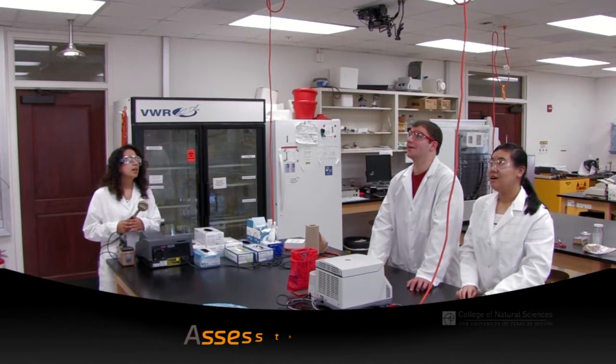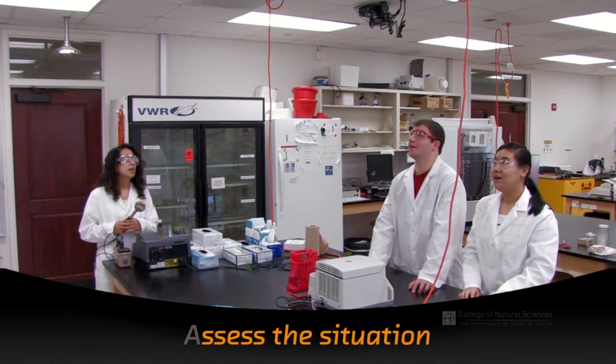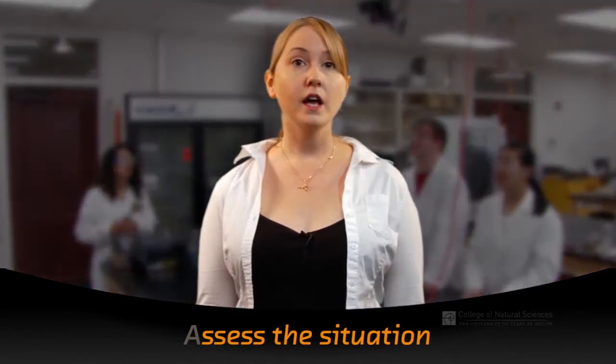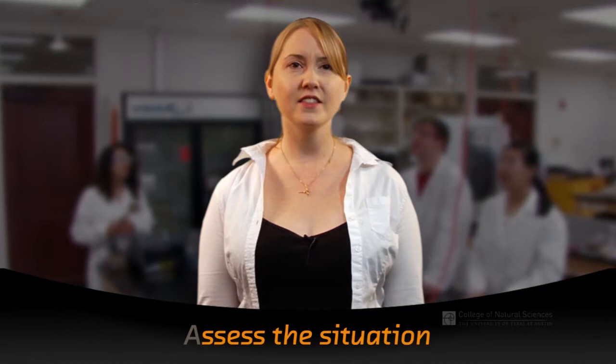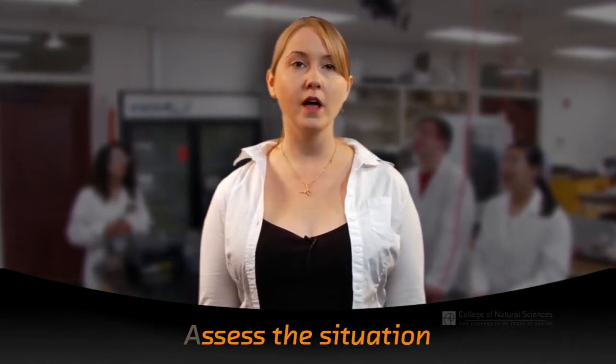Second, assess the situation. Is it a situation you can manage on your own safely and comfortably, or is the situation out of control? If you are not comfortable dealing with the situation or don't know what it is, this is okay. Notify someone immediately who can help and avoid touching things in the area.